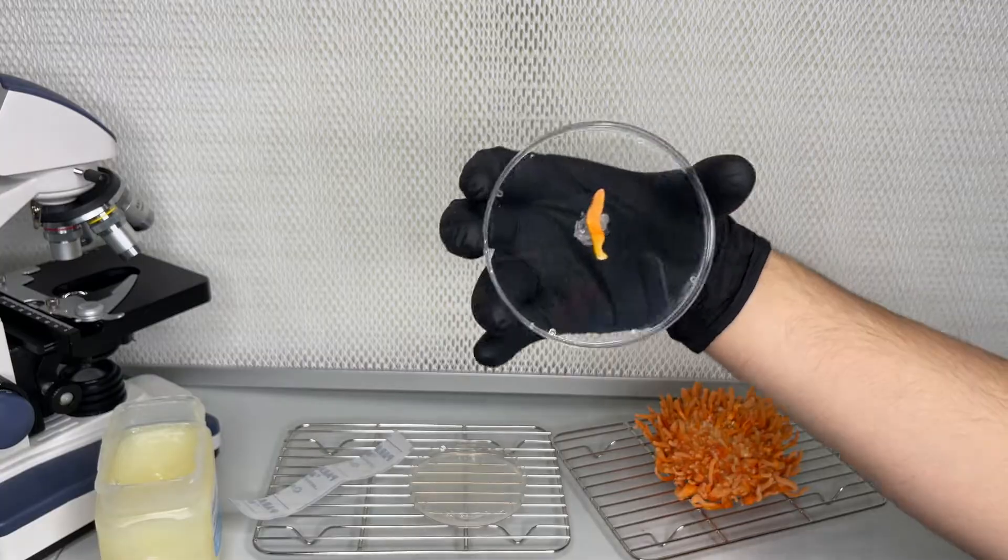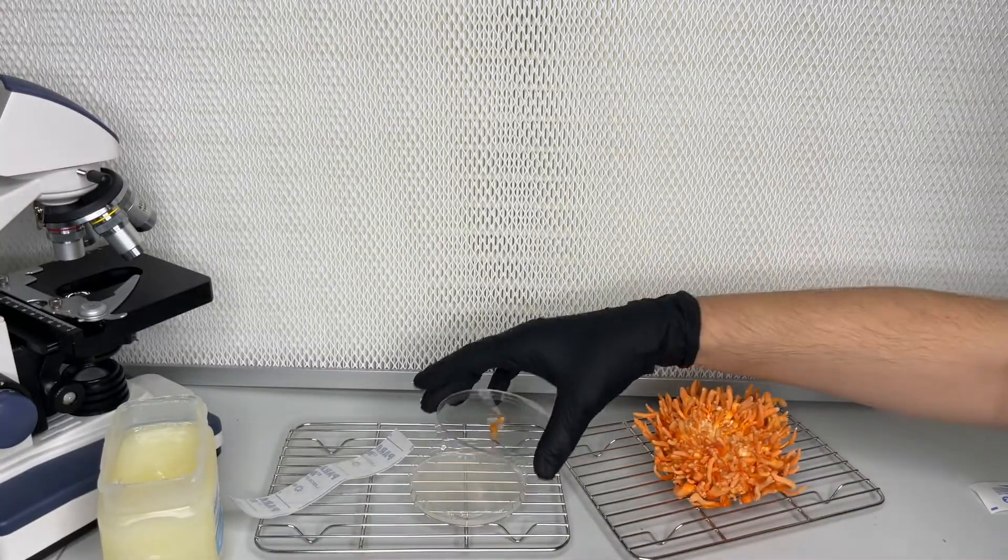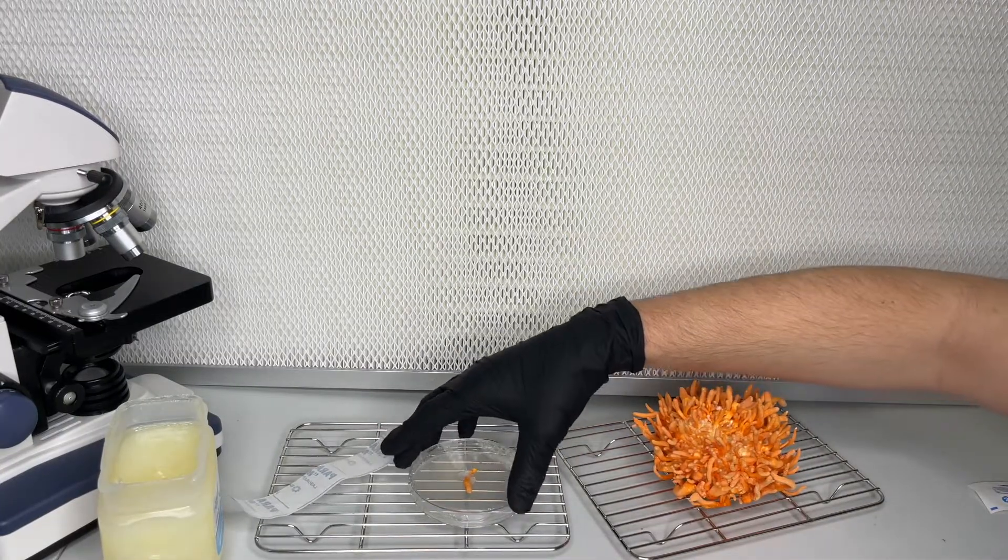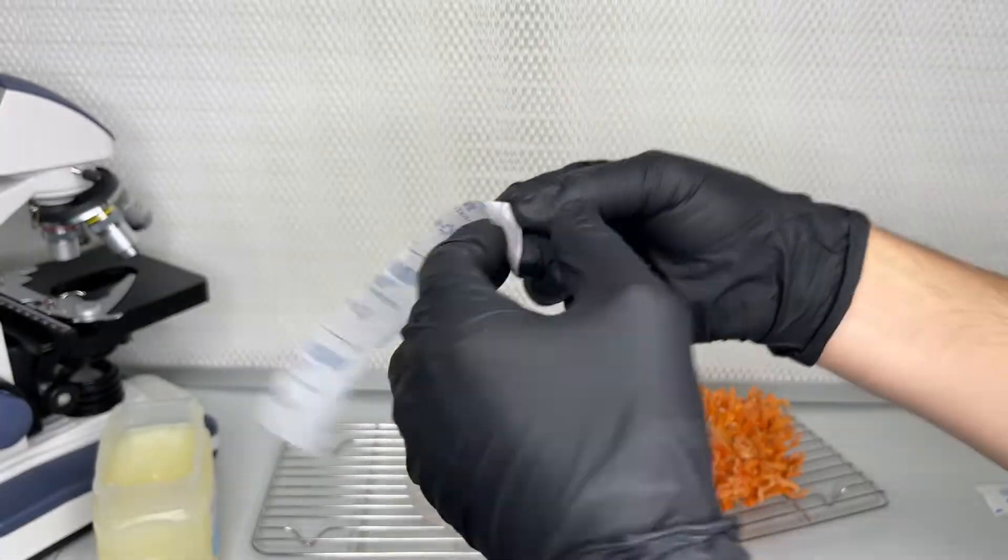It's not needed in this method, but you can use a microscope to get a closer view and maybe find the clamp connections that verify the dikaryotic mycelium.